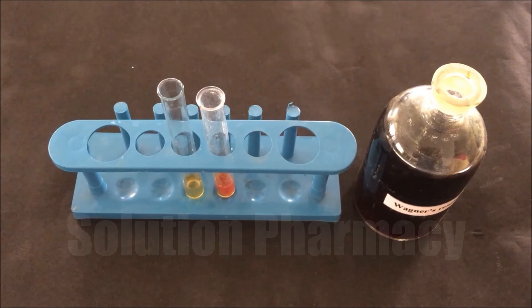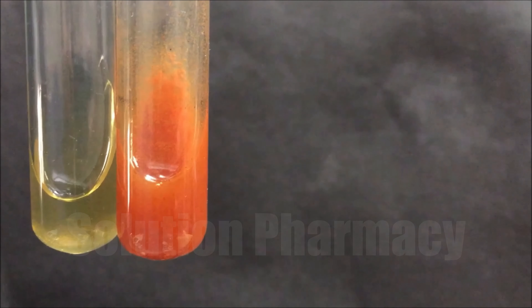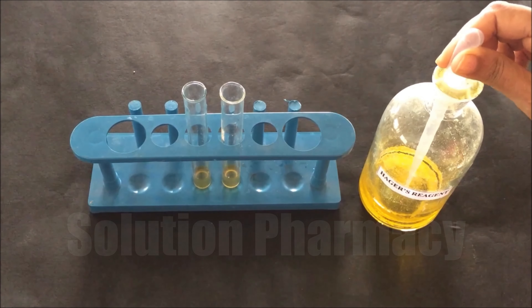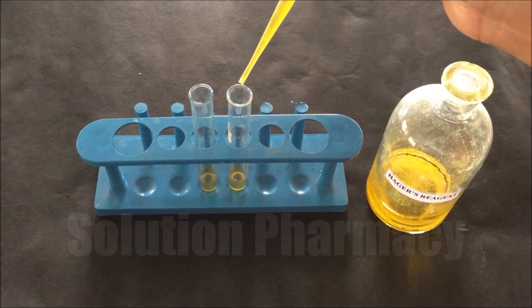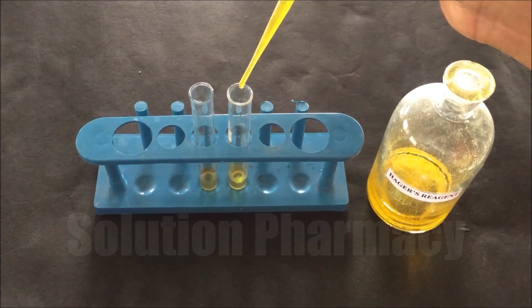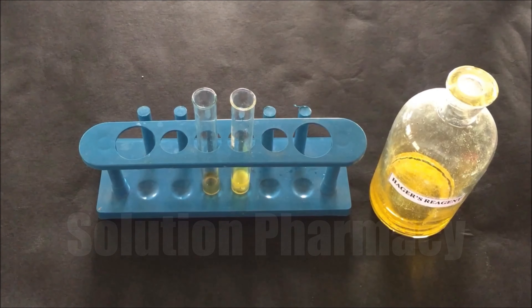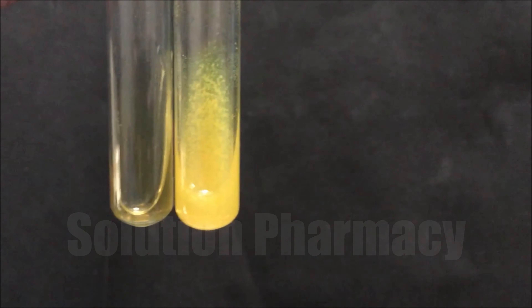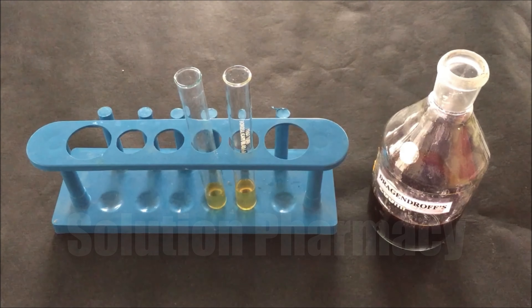Formation of a reddish-brown precipitate with Wagner's reagent indicates the presence of alkaloid in the sample. Now we perform Hager's test: add a few drops of Hager's reagent to one test tube containing the extract and compare with the second test tube. Formation of a yellow precipitate indicates the presence of alkaloid in the extract — here you can clearly see the formation of yellow precipitate, which confirms the presence of alkaloid.